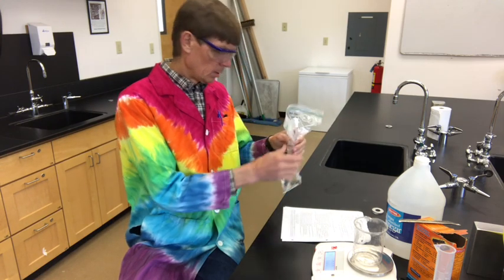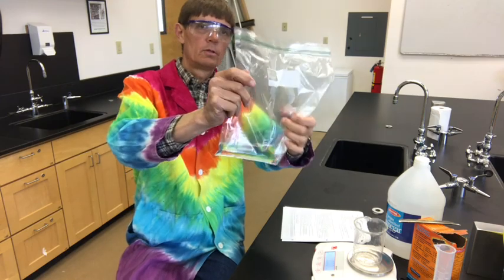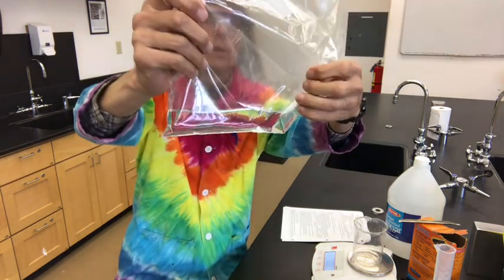All right, so now I'm going to take it out of here and we're going to shake it up. We're going to put this stuff together and watch it react.